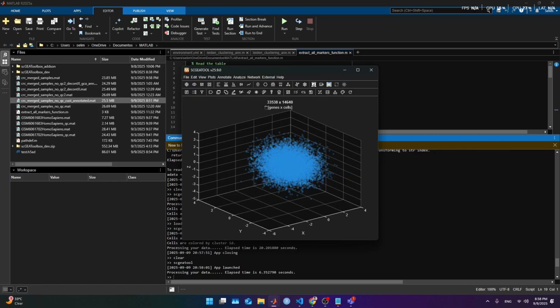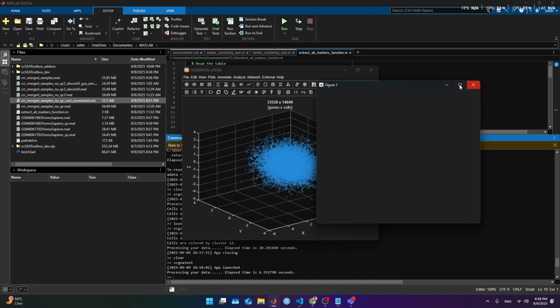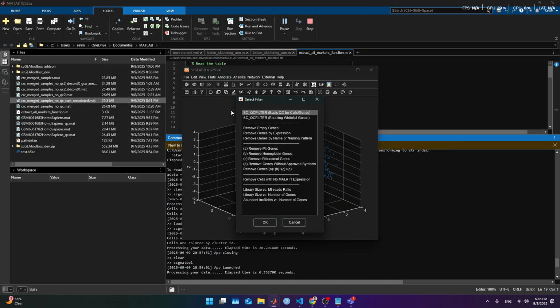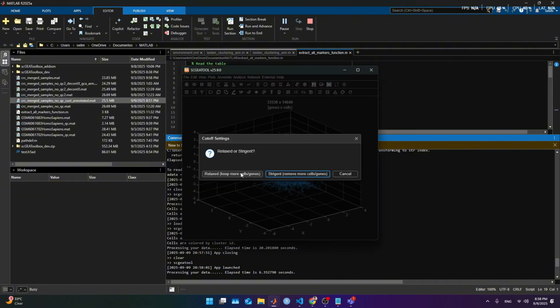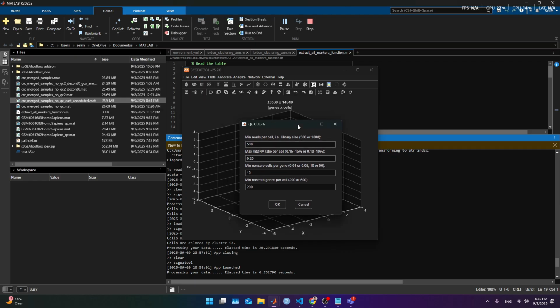Okie dokie, it gets 33K genes and 14K cells. This time we are going to look first into the quality metrics, and as we see, it's similar: 4,000, 1,000, and mitochondrial also around 5%. What we are gonna do this time is QC filter, but with relaxed. It's something we shouldn't do, especially with newer data sets, which should come with better quality.